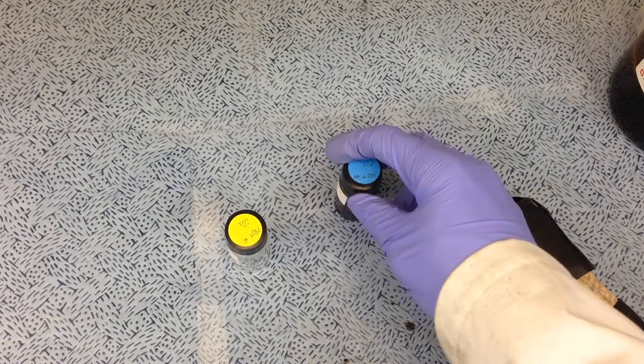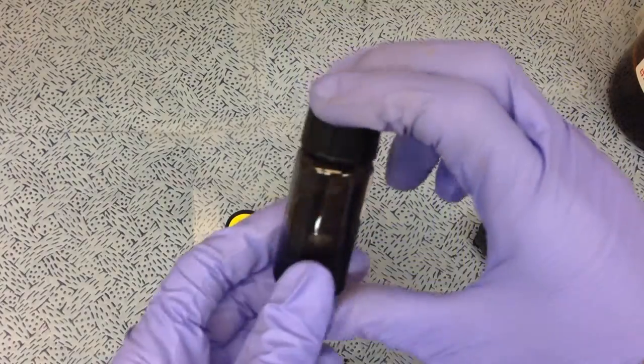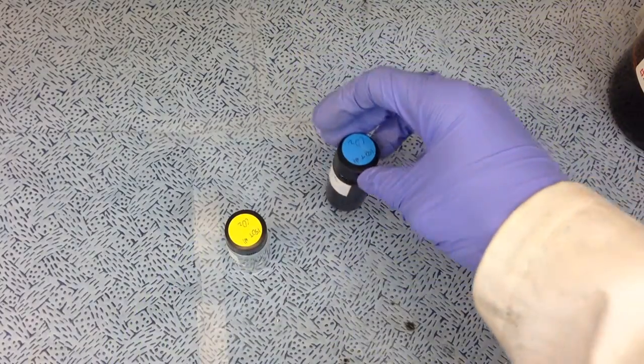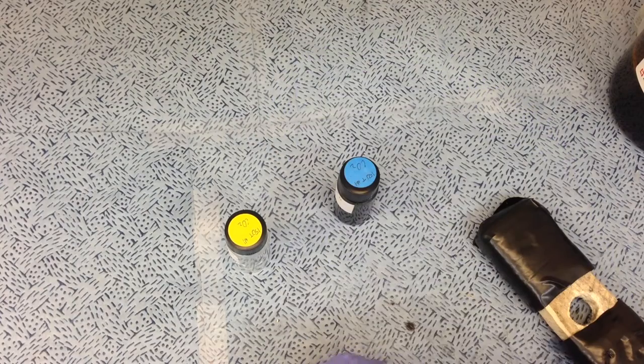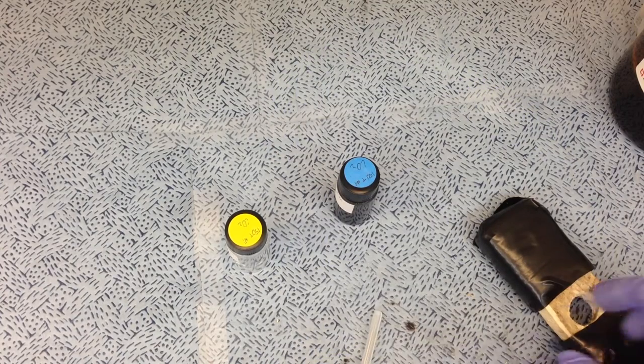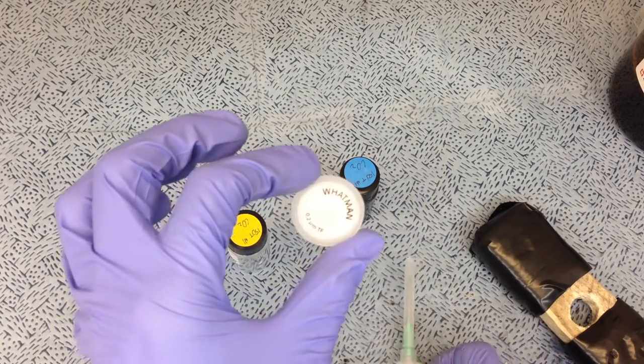help fix that problem. So if you've ever spent time filtering really cruddy solutions with a lot of precipitate or solids in it, and you've been using these little syringe filters, you've probably had your fingers messed up and maybe even had to switch filters or tools because it was too hard and the filter got clogged.